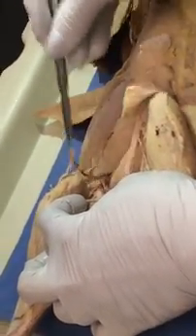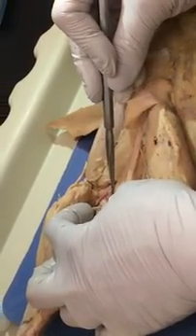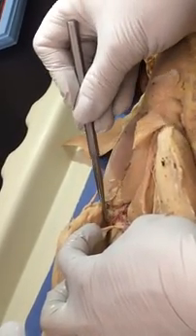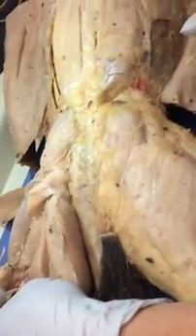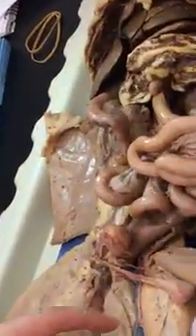Oh, this cat's pretty. So the popliteal comes out the back of the knee, and a little bit of it comes towards me, and that's the posterior tibial. Most of it keeps going in deeper, and that's the anterior tibial. It's very nice on this cat. Yeah. What else?